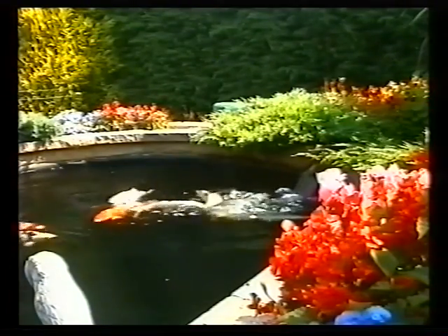9 common parasites that invade our koi. Occasionally, we also detect parasites that are not so common. This video, however, will concentrate on the 9 you are most likely to find.